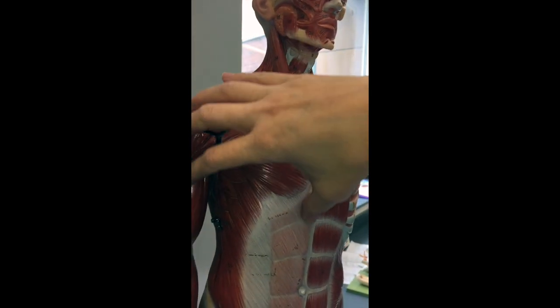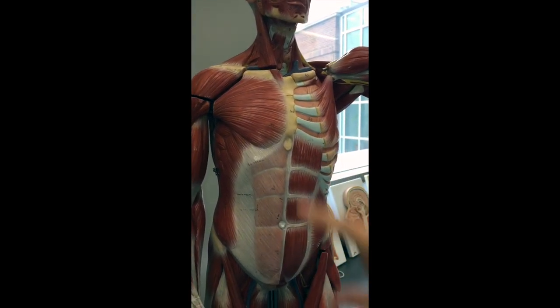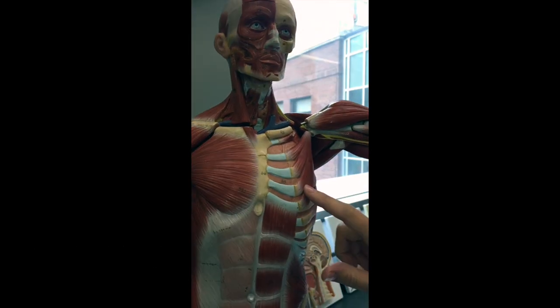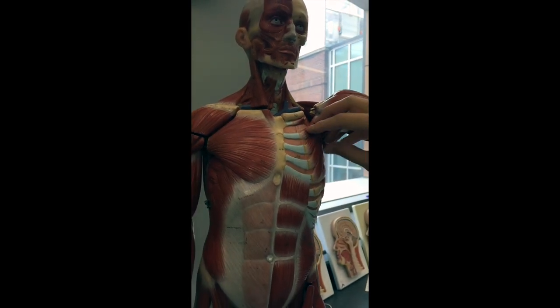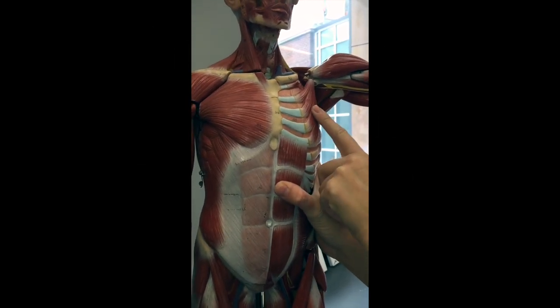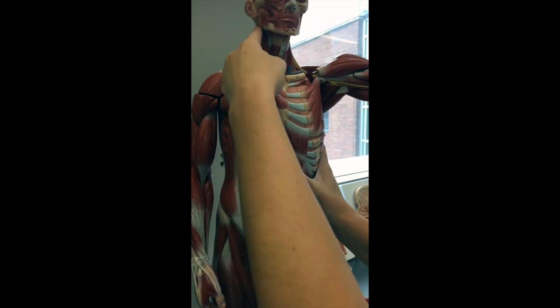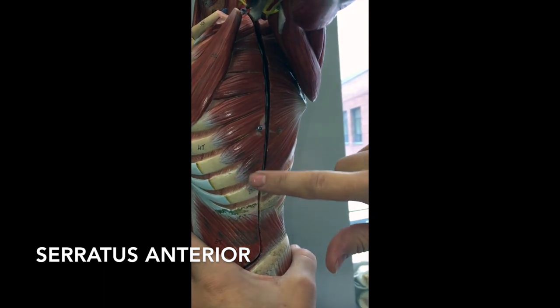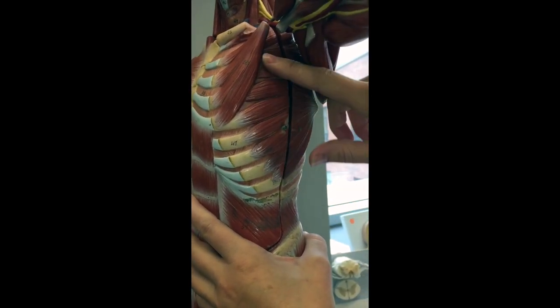This is still our superficial side of muscles, just under the skin. This is the deep side — if we take these muscles off and look underneath, this is what we're going to see. This big pec muscle is going to be your pectoralis major. If you rip that off and look underneath, you have a smaller muscle — this can be the pectoralis minor. Remember, in kitty the pectoralis minor is bigger and lower, but in humans the pectoralis minor is smaller and actually underneath the pectoralis major. So we have pectoralis major, pectoralis minor, and our sternocleidomastoid muscle here. If we look at the side, these little muscles that connect to the ribs are what we call the serratus anterior — in cats called serratus ventralis. So serratus anterior is going to be right here.